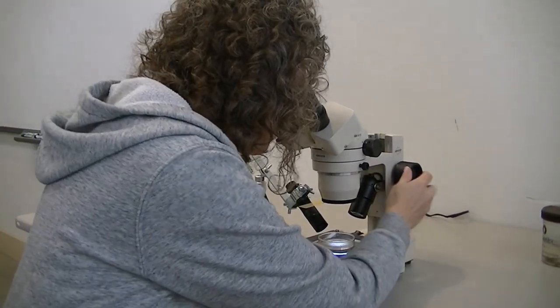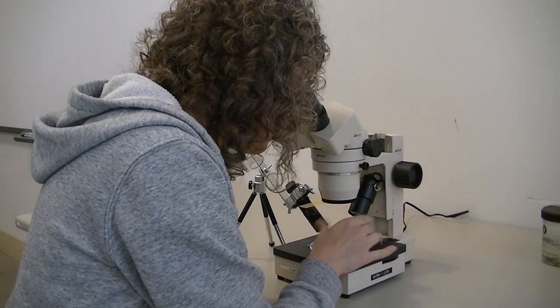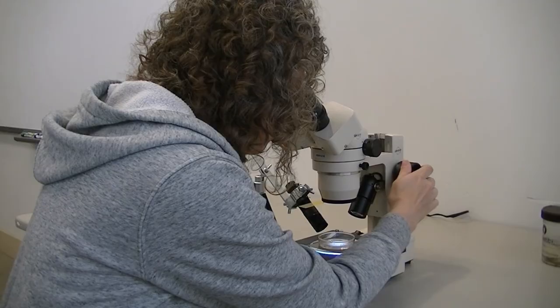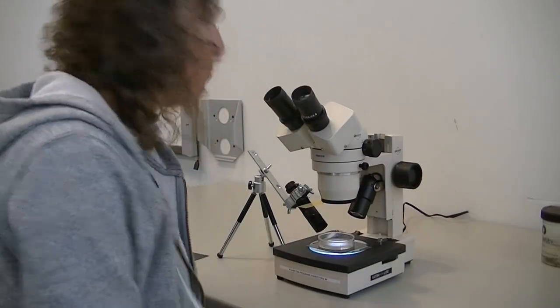I can see it's drifted a little bit, but I can see that there is no cellular structure. So that is our last check. I'm checking the camera and going to switch over.